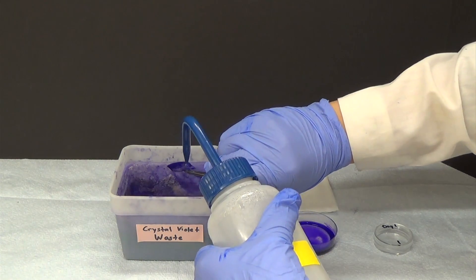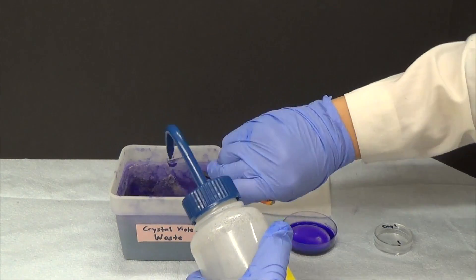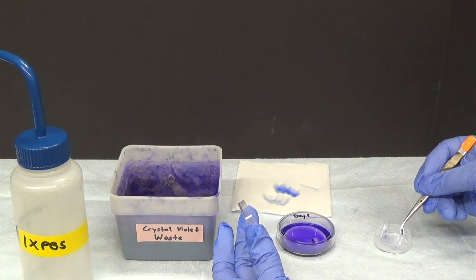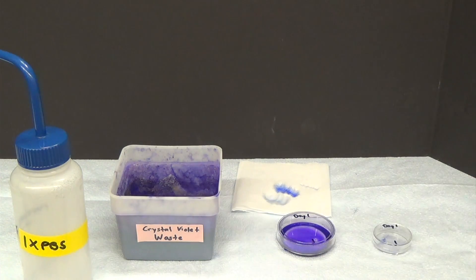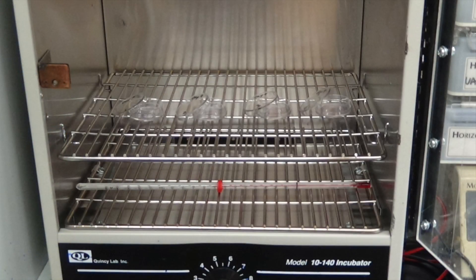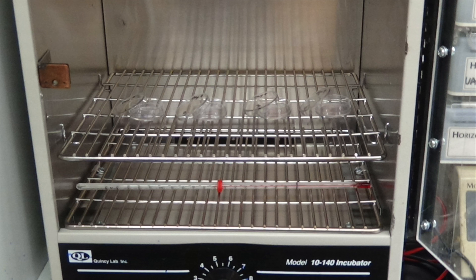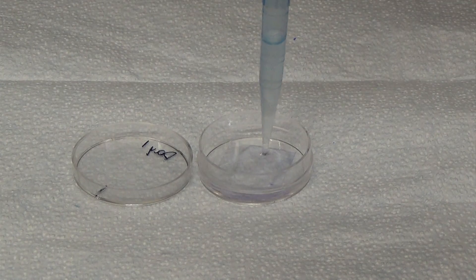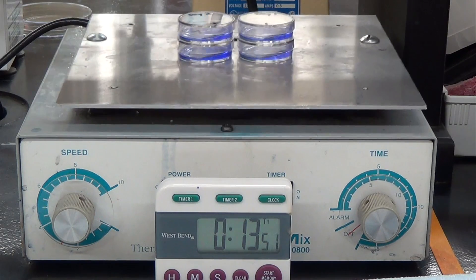Again, orientation should remain the same. Transfer each cover slip to a labeled 35mm petri dish and let dry for 15 minutes in an incubator set to 60 degrees Celsius, with the lid slightly ajar. Once dry, add 1ml of 95% ethanol to each petri dish. Incubate, shaking gently, for 15 minutes.